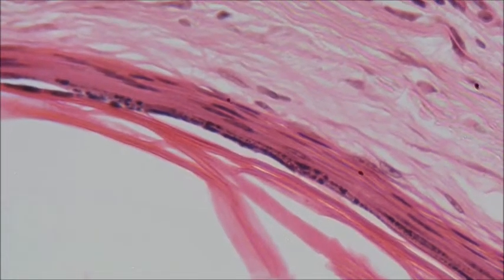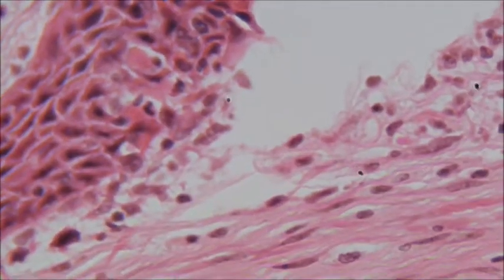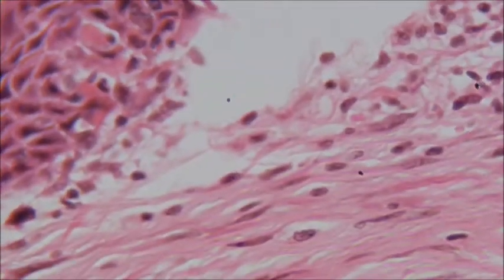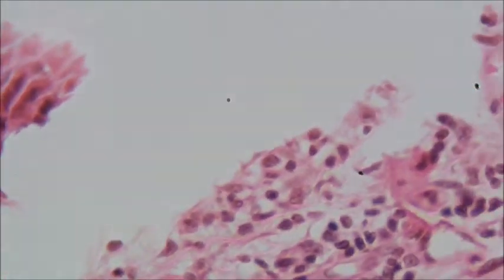So that's like the top of the skin surface. And you can see those dark parts that are flattened out. They're actually nucleuses of long, skinny skin cells. Now this is below the skin surface, a lot of muscle cells, and you can see all this tissue bunched together, and all these dark bits again are the nucleuses of cells.